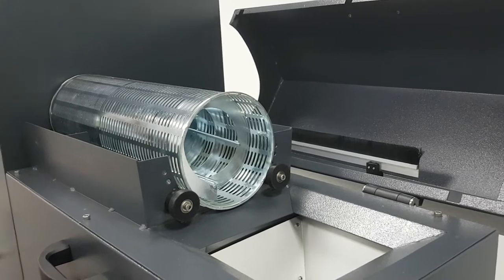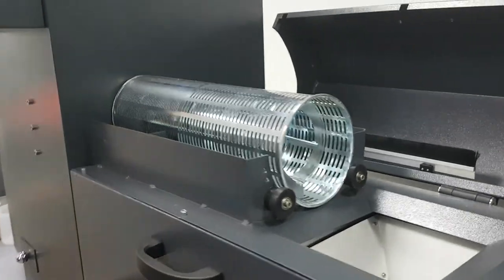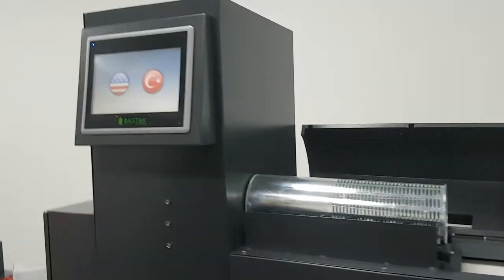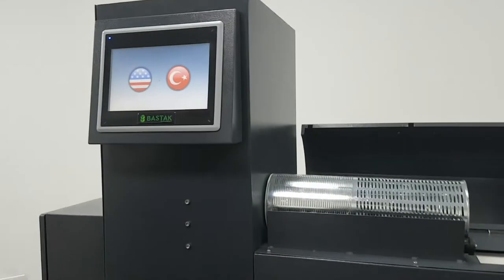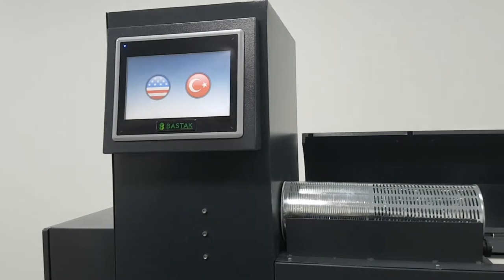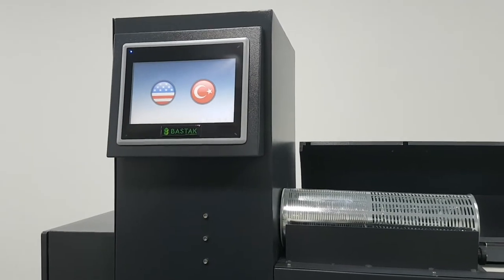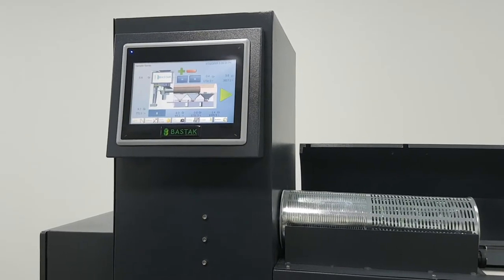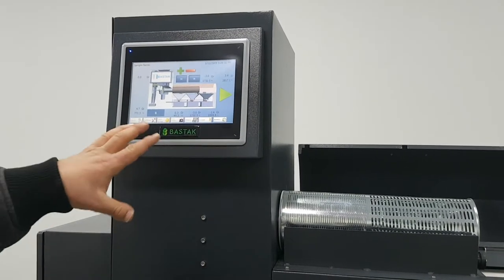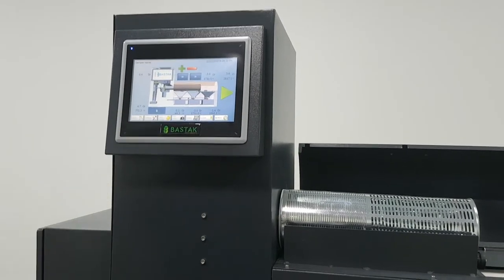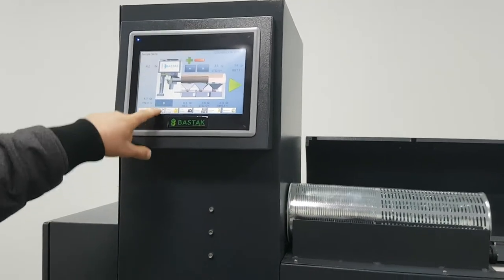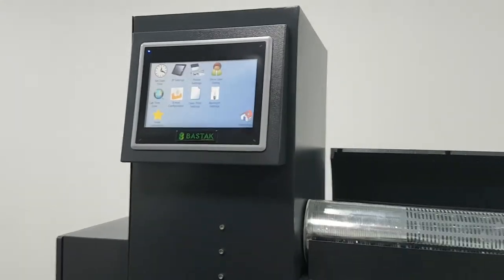Now the machine - we can choose the English language. The machine will start. We have the main screen. First of all, we have these settings.